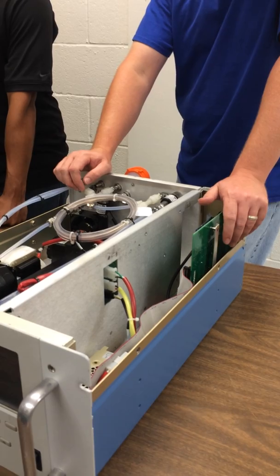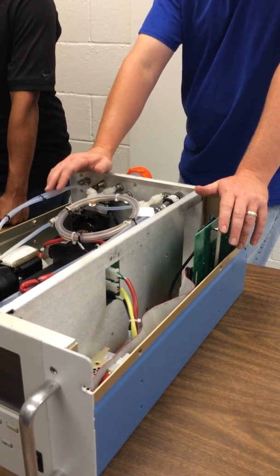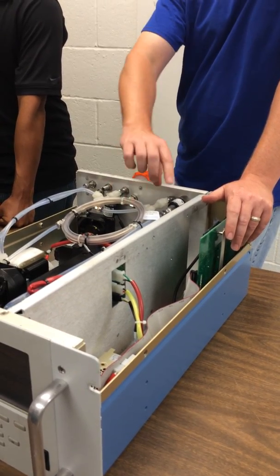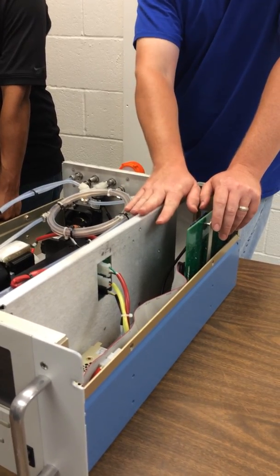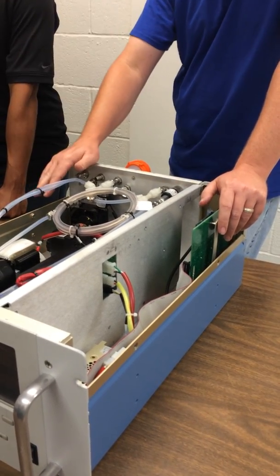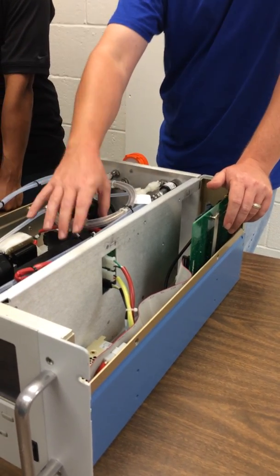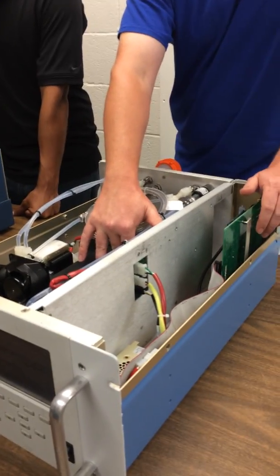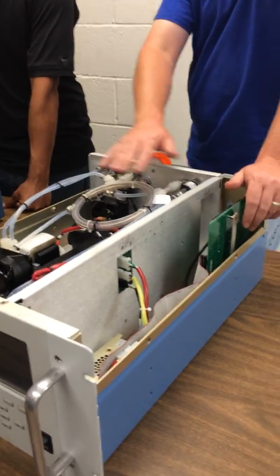So what we'll do is either through the data acquisition program where we can send the commands, or we can use the internal program in here. We can have this instrument do it once an hour, or as fast as we can go if we let the instrument do it. We can do whatever frequency we want if we do it through the computer. We'll go in, we'll route the sample through the reactor for the catalyst, and we can get our zero, check our baseline. It does drift.